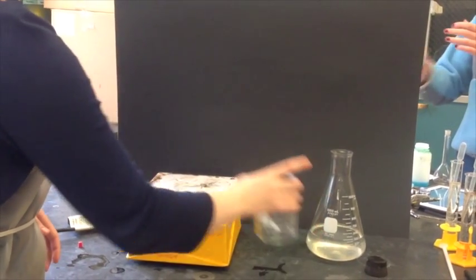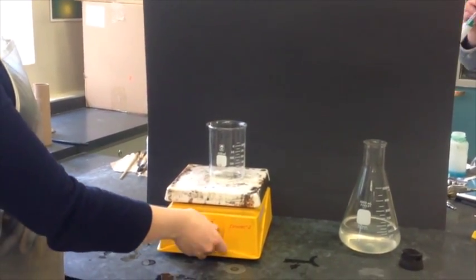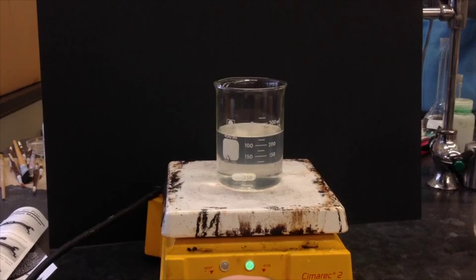You're going to put your magnetic stirrer in your beaker and place it on the heat pad, and you're going to turn on the stir button. Quickly, let's review pH. pH is a measure of how acidic or basic a solution is. The pH scale goes from 1 to 14, 1 being the most acidic and 14 being the most basic.